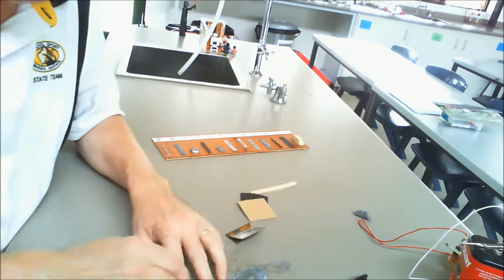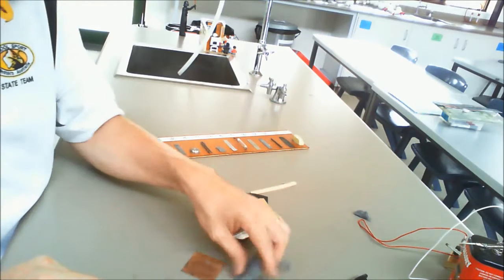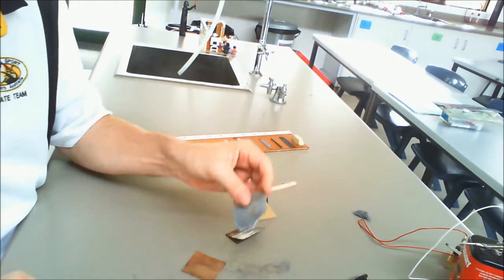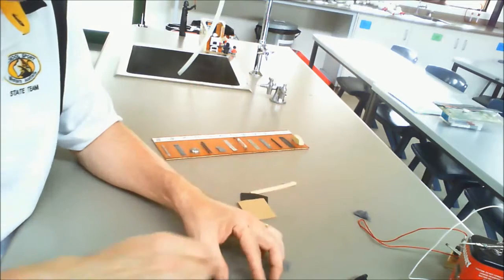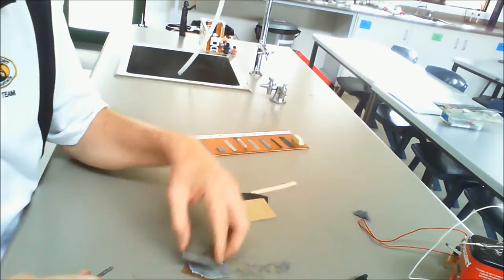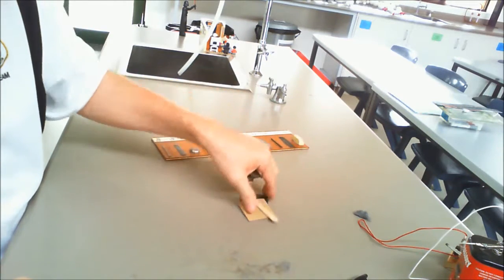Obviously metals are a different kettle of fish, much harder. I can scratch, but it takes much more force in order for that to happen. So these are basically harder materials than the non-metals. Now from that you can complete your observations on properties of metals and non-metals.